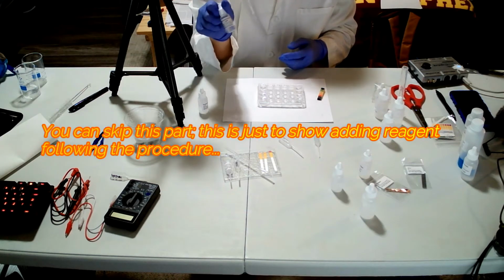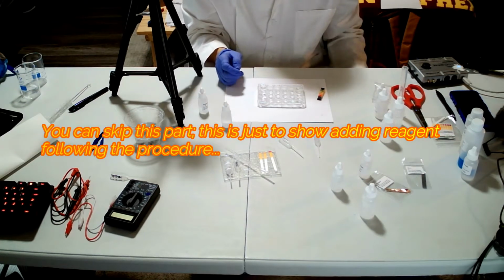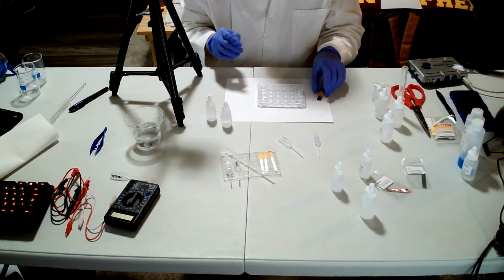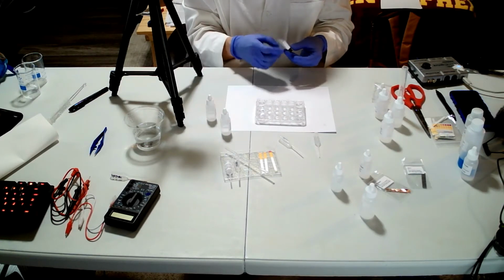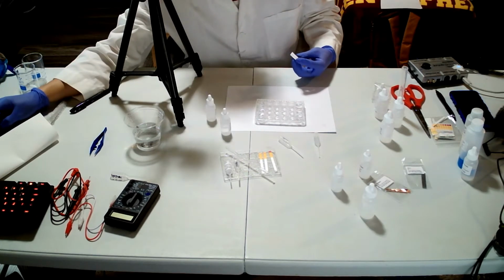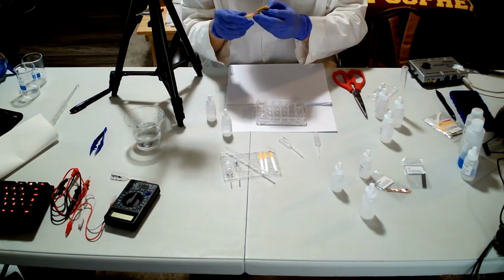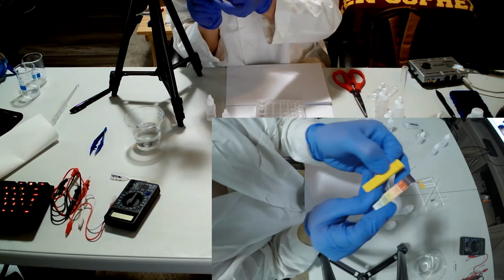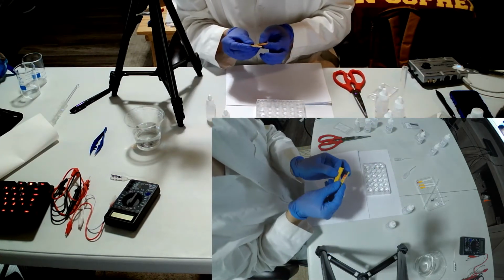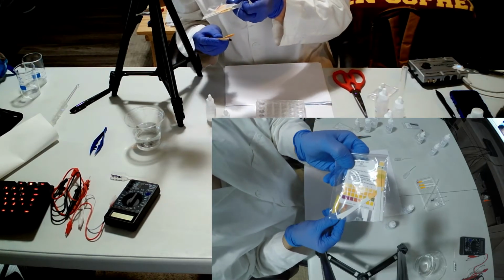Keep in mind this is 2 molar, not 6 molar, because that is what I have. So it is going to be different concentration. We'll need to test those, right? And you see that is somewhat different from the previous video. So you see that? So that is different from what you have seen from here. So they are 2 different things.